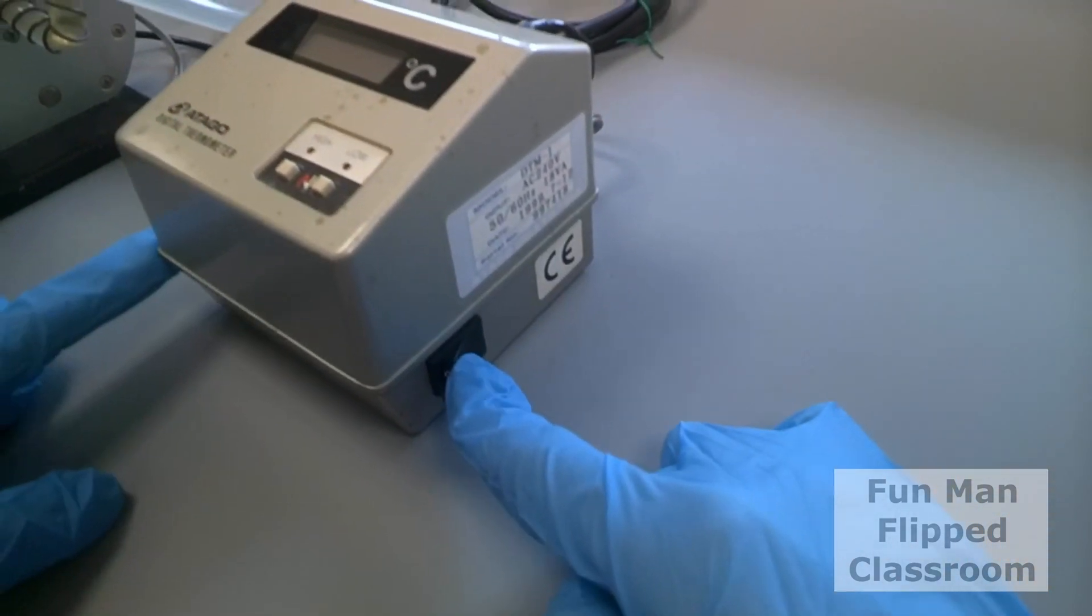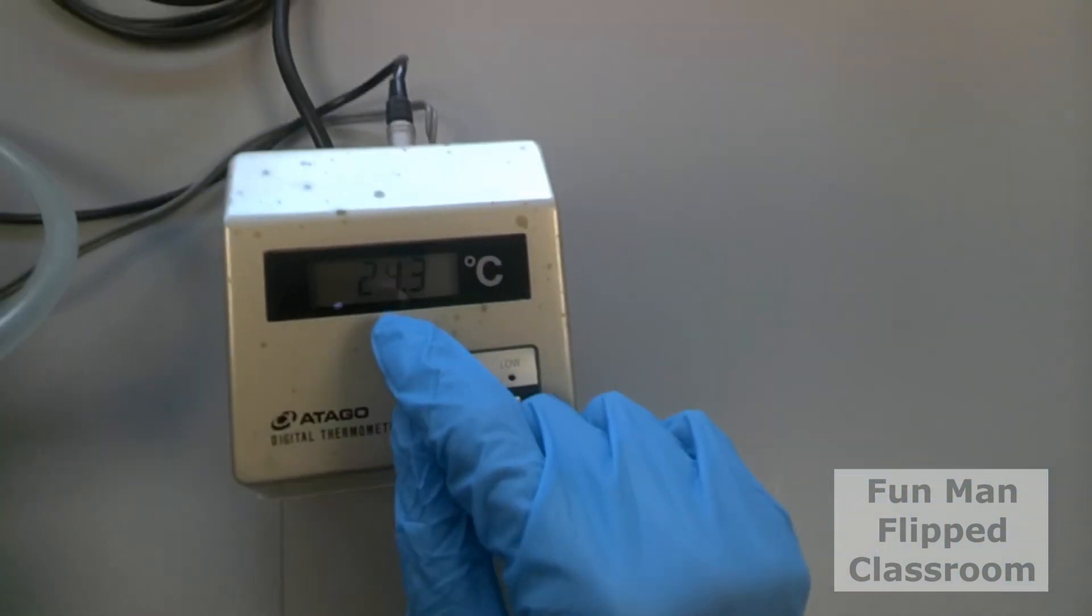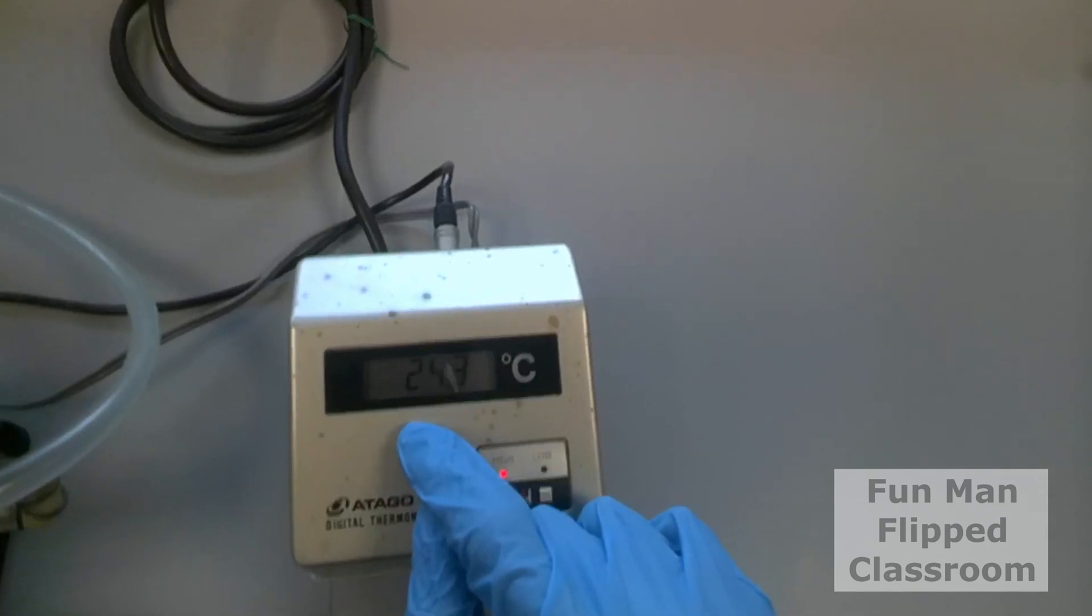Here, switch on the main system. The power switch is on the right side of the thermometer. Note the reading on the display panel. You should monitor this value.